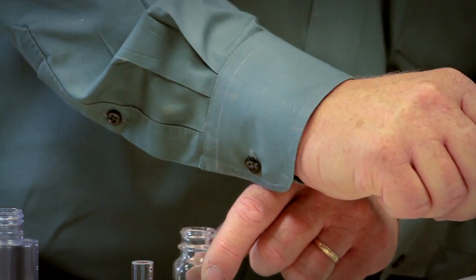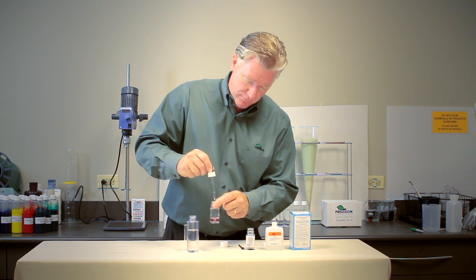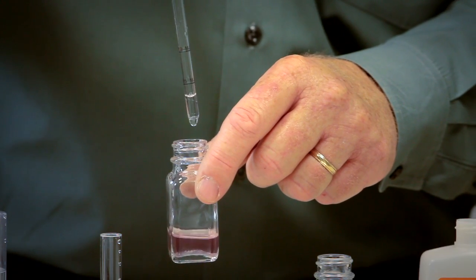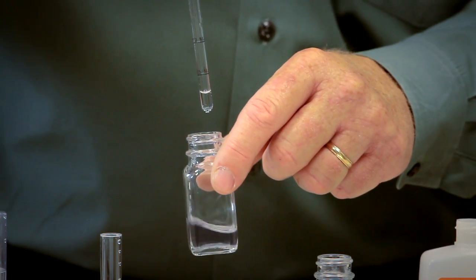Let's get some more titration fluid. 11, 12, 13, 14, 15, 16, 17, 18, 19, and here we go.